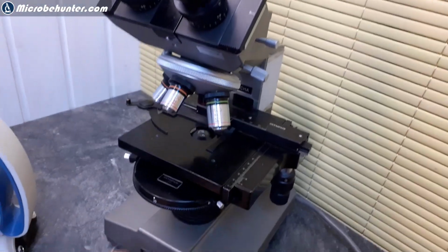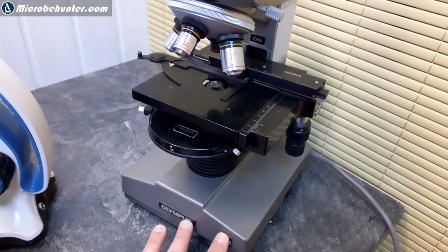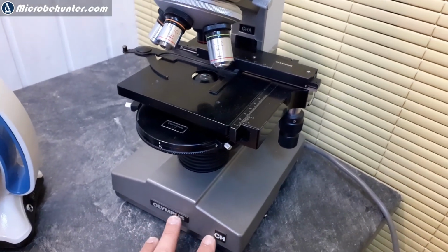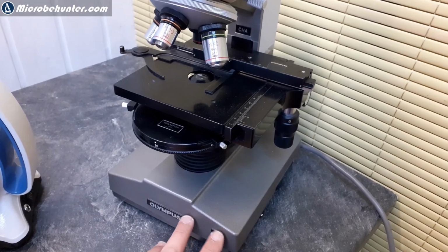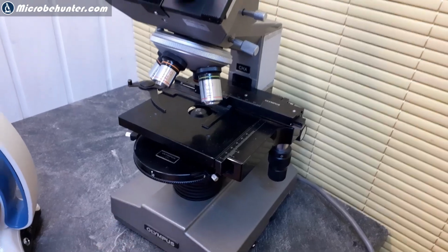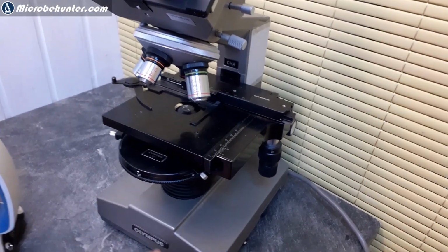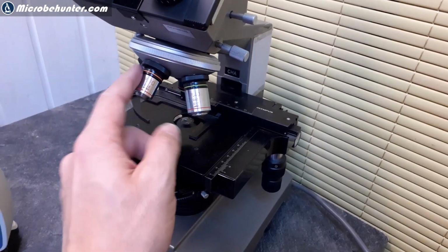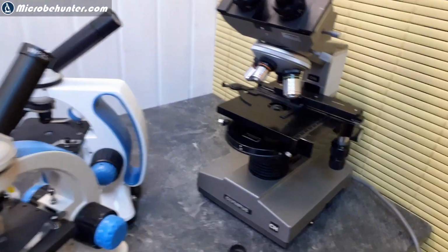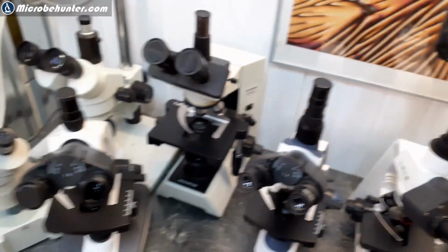But again, used microscopes are not automatically something that I recommend, also because they're not cheap all the time. You can get very high quality in used microscopes, but it depends quite a bit on what condition they are in, and it can also be an incomplete microscope and you need to shop for additional objectives. So that is basically the general overview that I want to give you here.